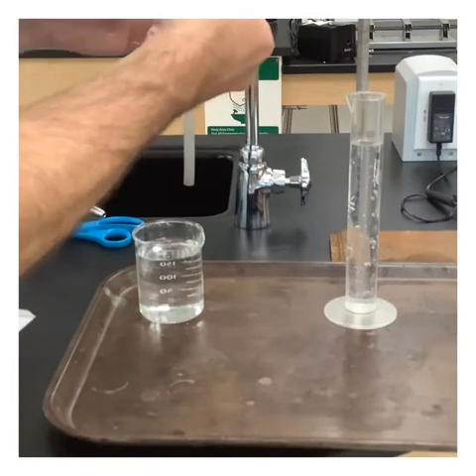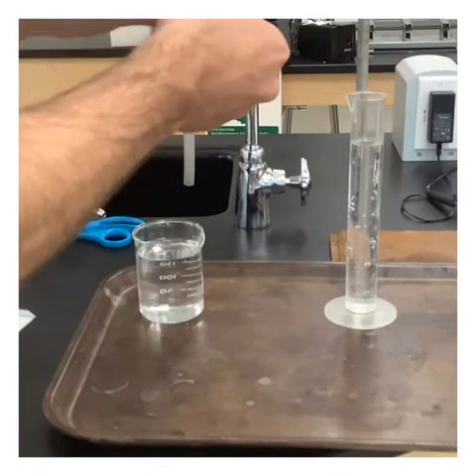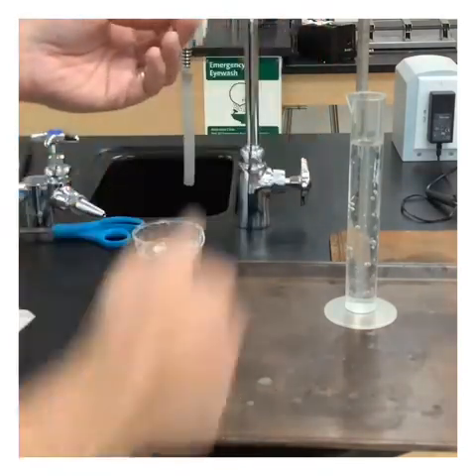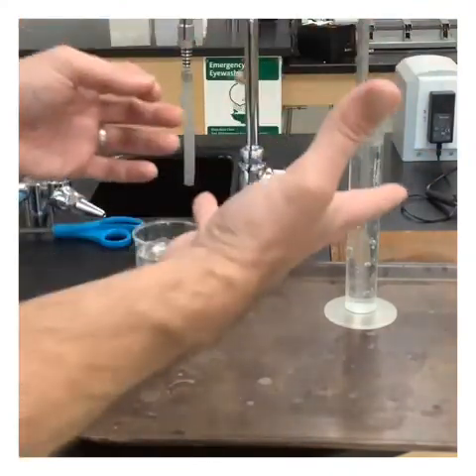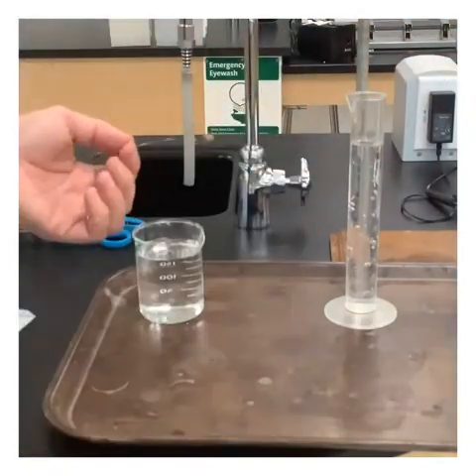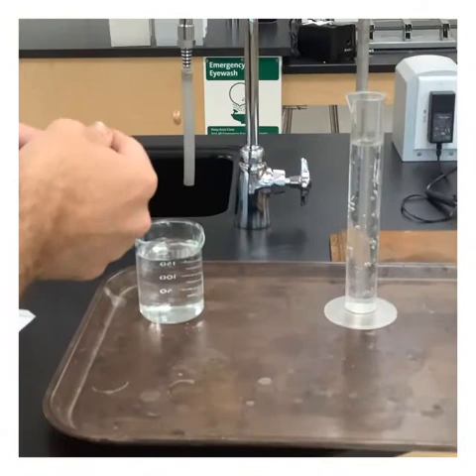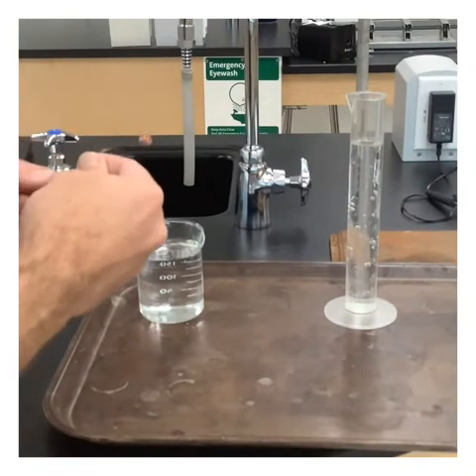All right. The next thing that we need to do is react this zinc. Excuse me, I keep saying zinc, it's magnesium. We need to react this magnesium with acid. And we know that if I was to just do that in a test tube or something, there's going to be a lot of oxygen there, and that's going to contaminate the sample. And so we want to get as pure of a sample as possible. So a bunch of you in your heads right now should be screaming, bubble it through water. We need to bubble it through water. Yes, we definitely need to bubble it through water.